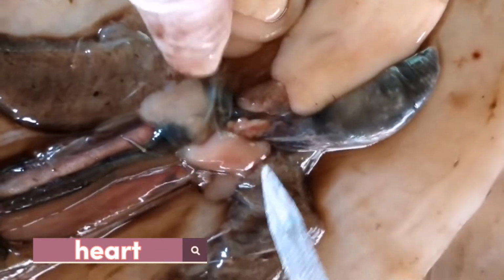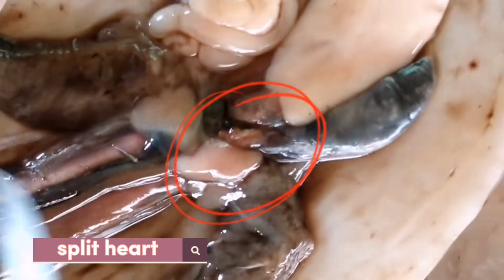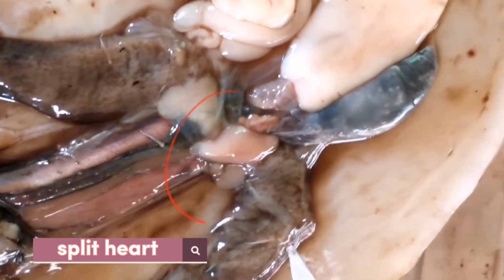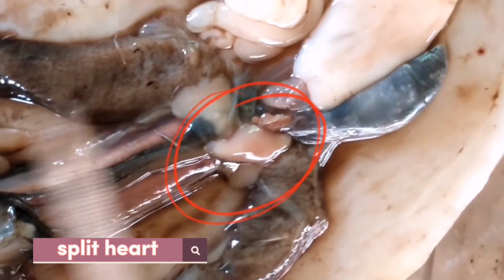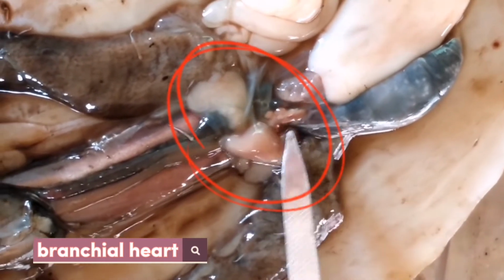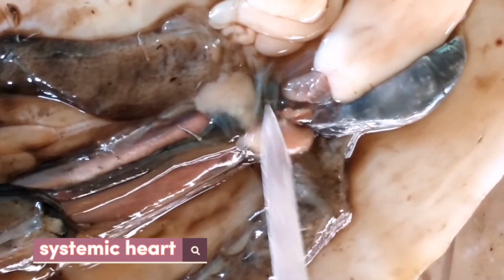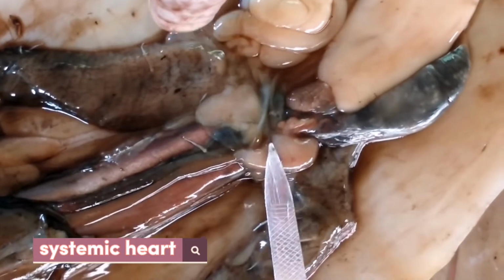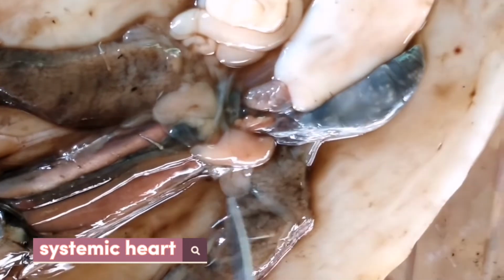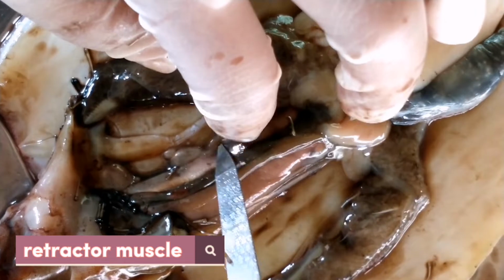And right above the gills is the heart, which is the systemic heart. The systemic heart is the main heart that pumps blood around the body as part of the general circulatory system. The systemic heart has 2 sidekicks called branchial hearts. They pump blood specifically to the gills, which are right below each one of them. The systemic heart has 3 chambers, which means 2 atria and 1 ventricle, which all work together to pump blood to the squid's body.